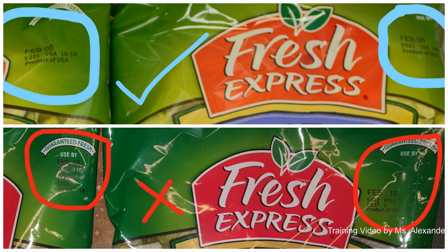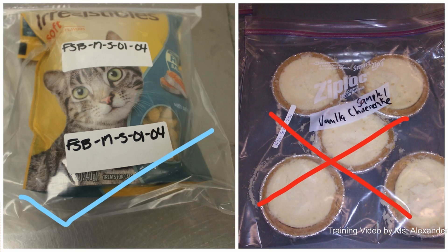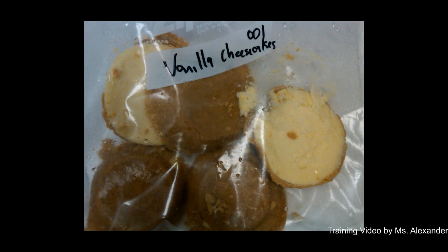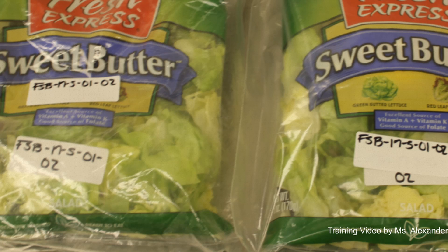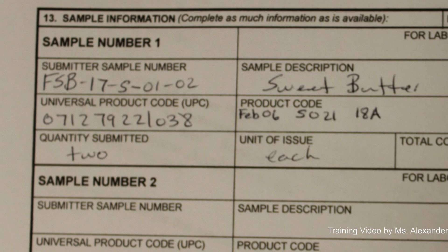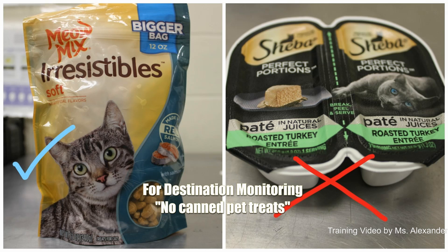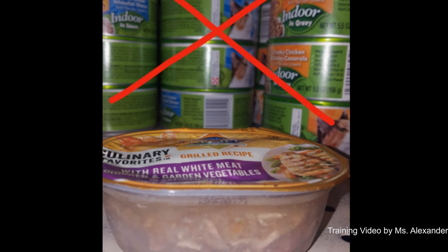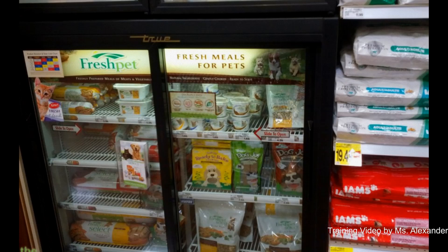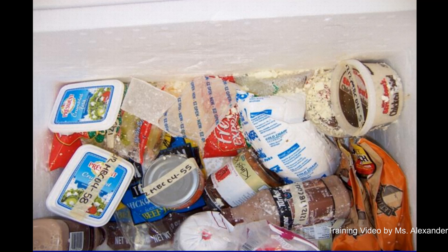Another common mistake is not labeling and separating your samples in individual Ziploc bags to prevent contamination. Samples must be packed and labeled according to your sample number in DA Form 7539. When tasked to send pet foods or pet treats during the destination monitoring program, do not send pet food in plastic containers or canned items. If chilled pet foods are not available, send dry pet foods packed in bags. In order to not waste any resources, send your food samples the right way.